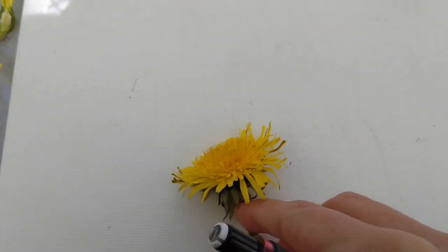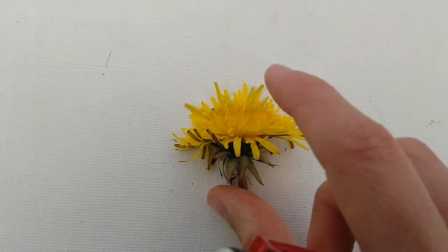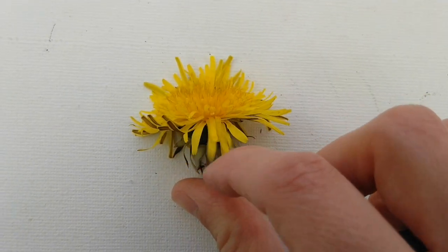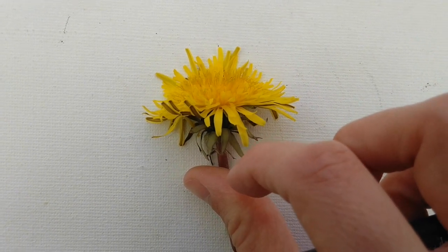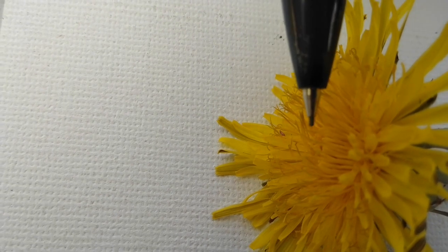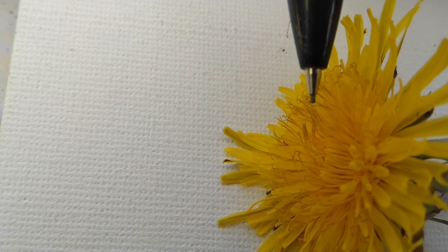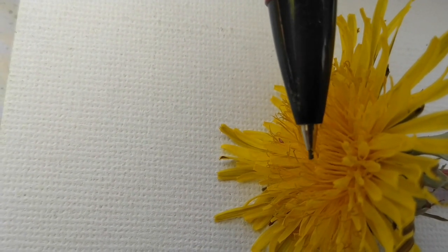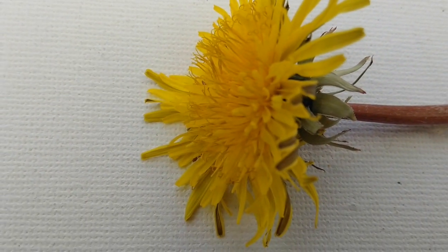But let's look at these petals. So dandelions do have petal-like things. There's another special science word for them that we won't get into today, but they do have some special petals, these nice yellow colored ones, to attract bugs. When we look inside, these parts right here, these are all pistils. And then the stamen are a little bit shorter down here. So I'm going to have to cut open this flower to get a closer look at that.